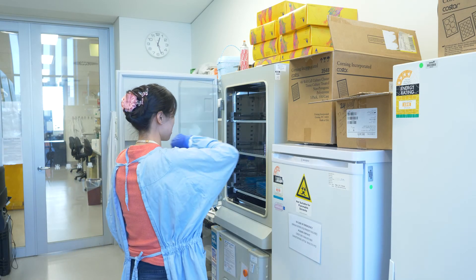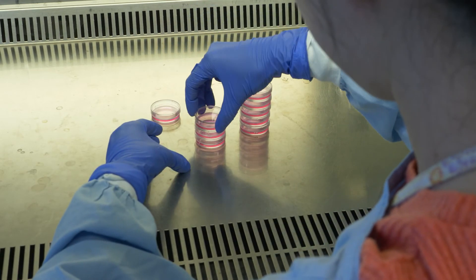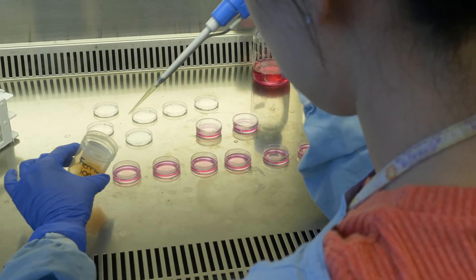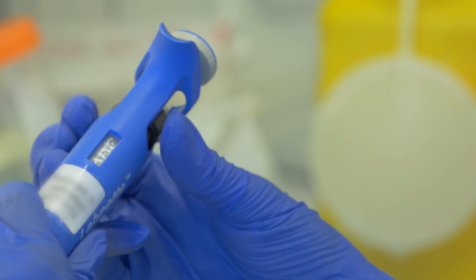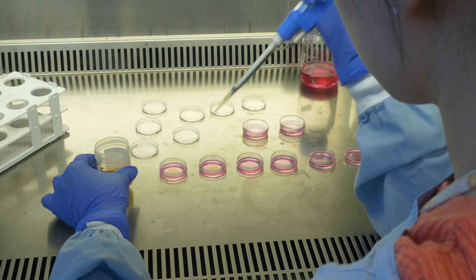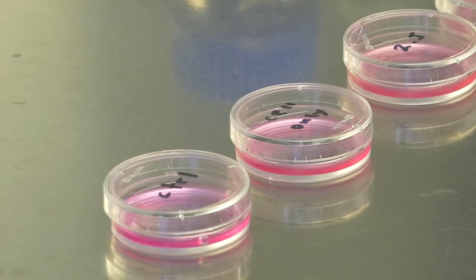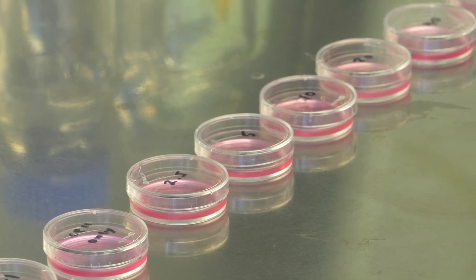We put the dishes back into the incubator and wait for another 24 hours. After waiting, JJ takes the dishes out of the incubator and places them in the hood. Now we have cells attached to the bottom surface of the dishes, which have been incubated with carbon quantum dots. As you can see, we have made the solution of ferric ions in this container as the stock. JJ will transfer different volumes of ferric ions to each dish, except two dishes which are the control samples, with concentrations ranging from low to high. We leave the cells for 15 minutes to ensure the ferric ions have been taken up.